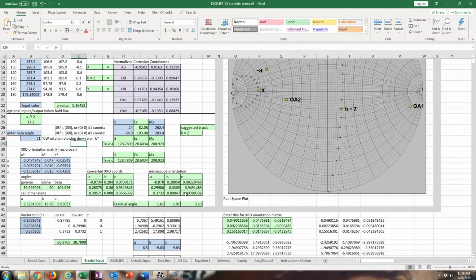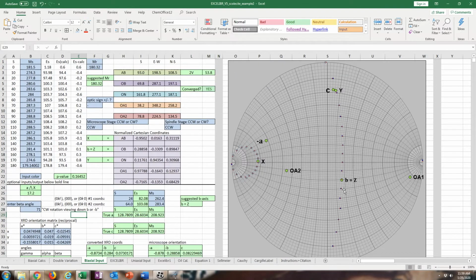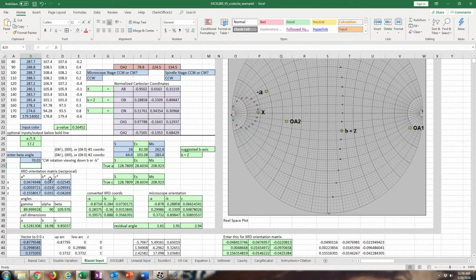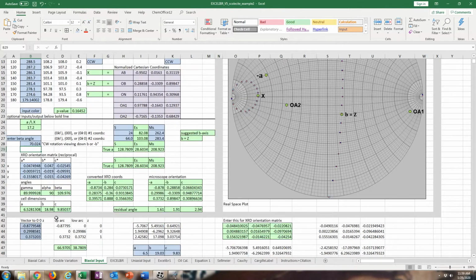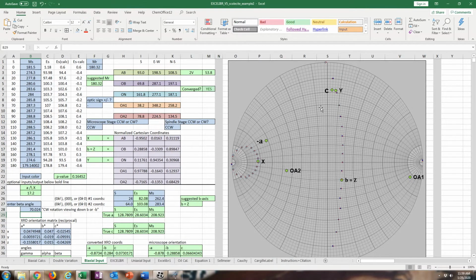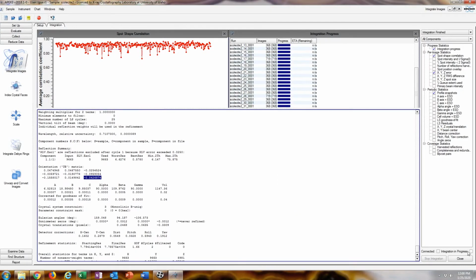C has a little bit more error than the others, but as you can see, very, very close. And that's after transferring the goniometer from one place to another. And remember, that's purely from the microscope orientation, just visually looking at indexing faces and determining the optical vectors and everything. So, looks pretty good. And that's what we have for a residual angle between the X-ray method and the optical way of doing this. And hopefully that matrix works, or that setting works.